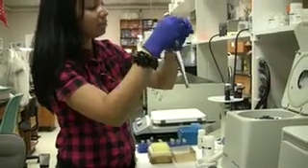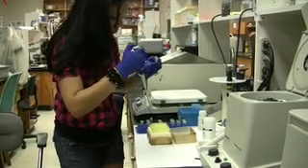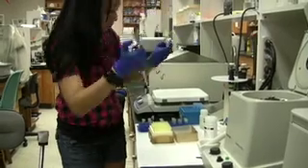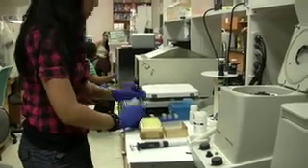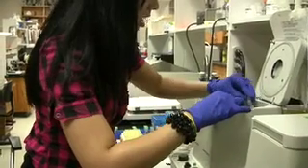I'm going to go ahead and take it out, transfer the liquid not touching the pellet. When I'm done with that, close them up, then go ahead and place them back into the centrifuge for two minutes at max speed.